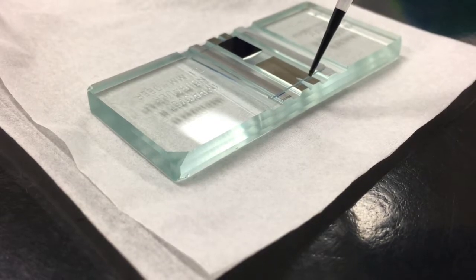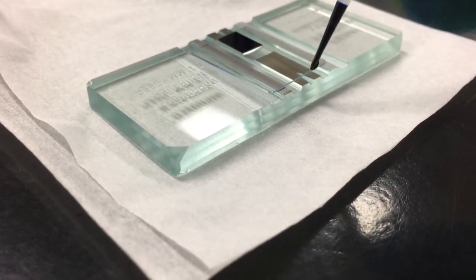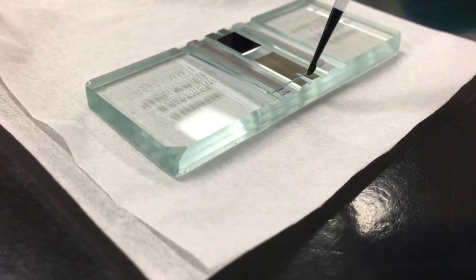Position the tip at the edge of the cover slip where it meets the central groove or the surface of the hemocytometer. Some hemocytometers do not have these grooves but are filled in the same way.